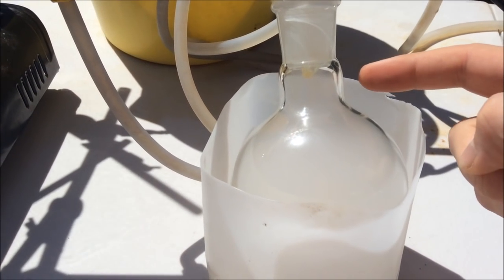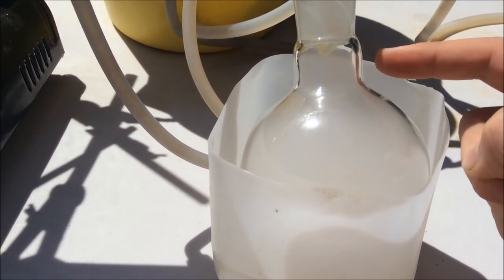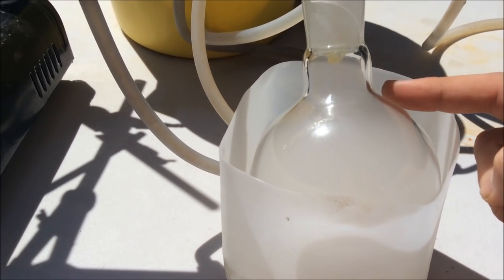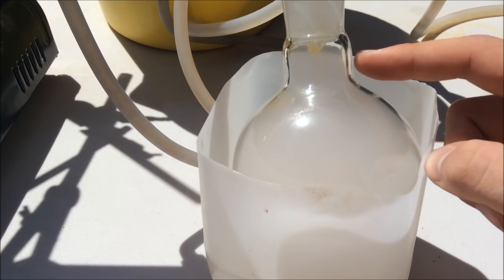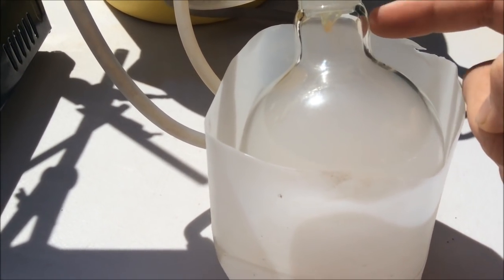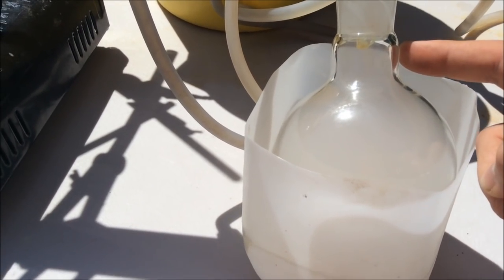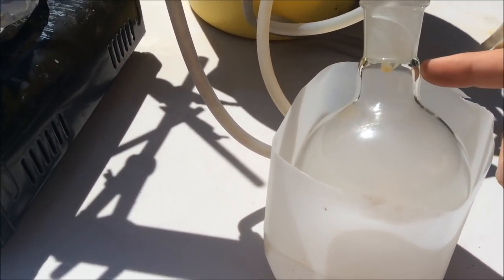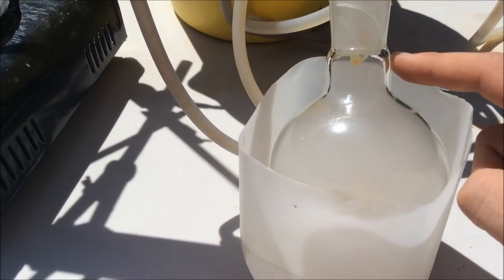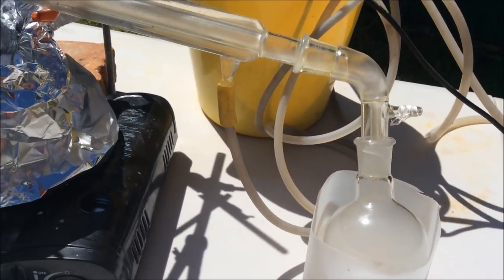So this reaction is working. I'm getting drops of a yellow liquid that was exactly what I expected the benzene to look like from pictures of other people doing this. Both the sodium benzoate and the terephthalic acid method produce this yellow sort of benzene, which we will obviously redistill to get rid of all the yellow. But I think it's possibly the worst yields of all time, this might be. This is the fastest rate it has been going all day. It's finally stopped just pumping out this white smoke as it was.